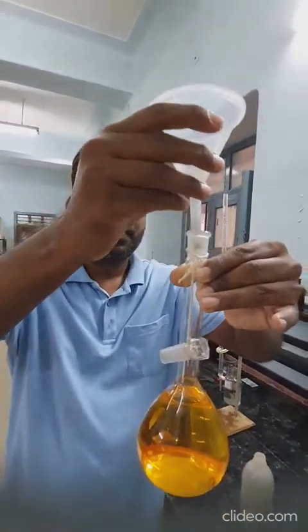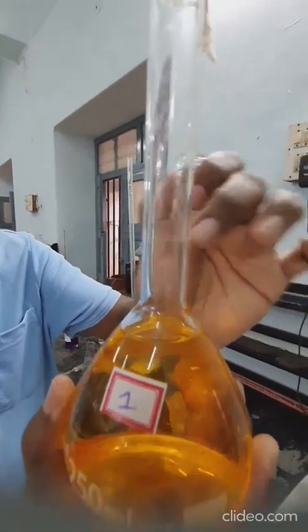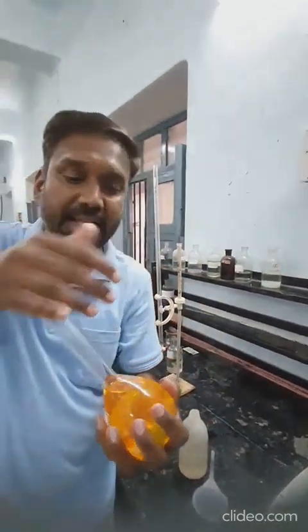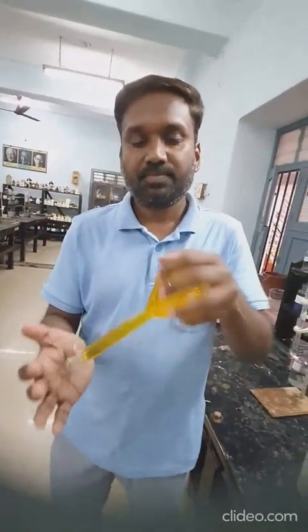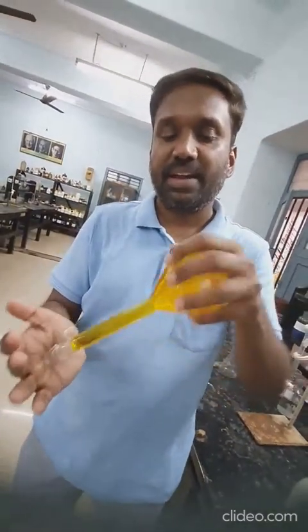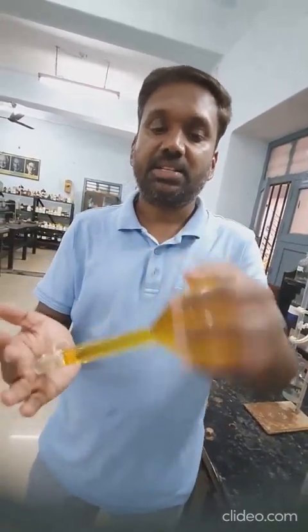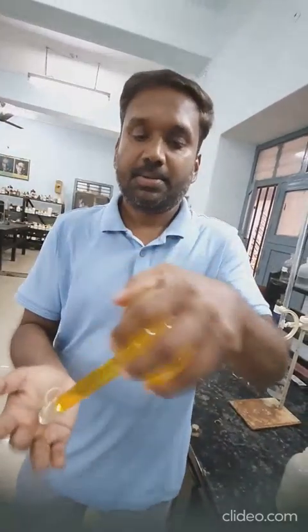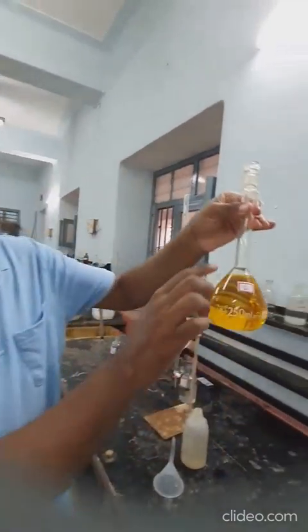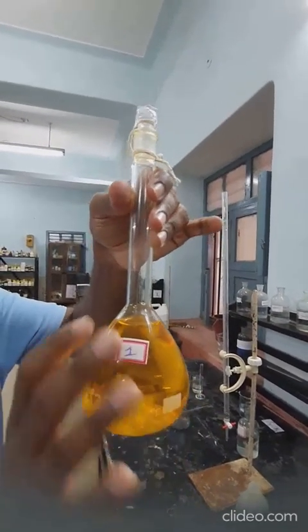You can notice the water level - it is not up to the mark. Instead, there is a gap. You can stopper it now and then dissolve the crystals. Since the potassium dichromate crystals are very soluble in water, it should not be very difficult to dissolve them. You can just shake and agitate this four or five times. You can see there is still a volume gap, so this is not yet the full standard solution. It will become a standard solution when you make it up to the mark.